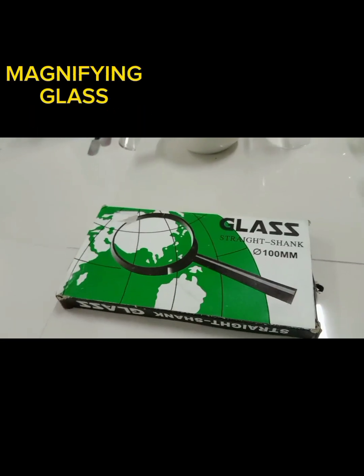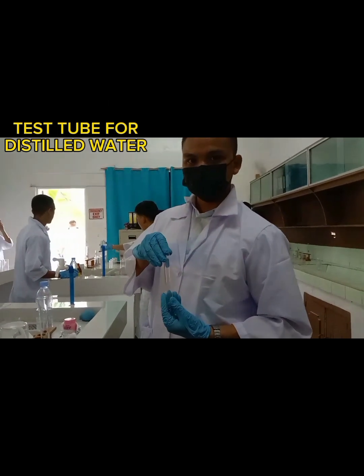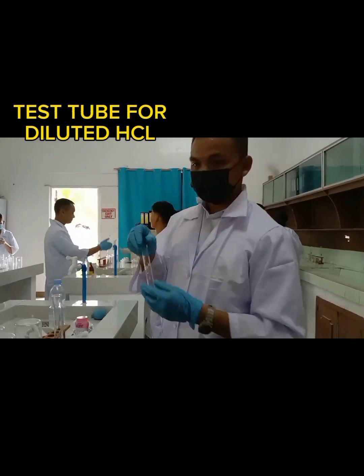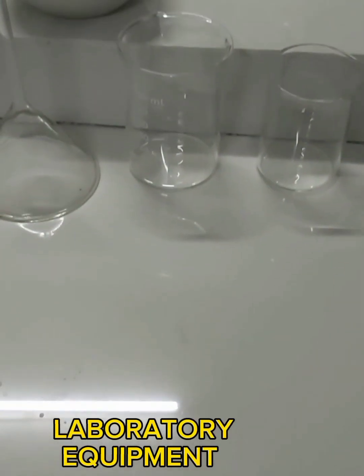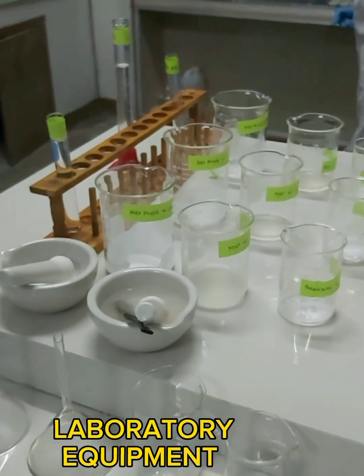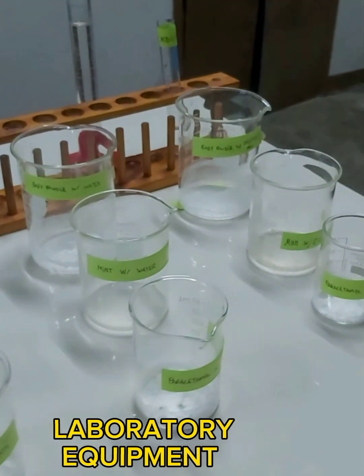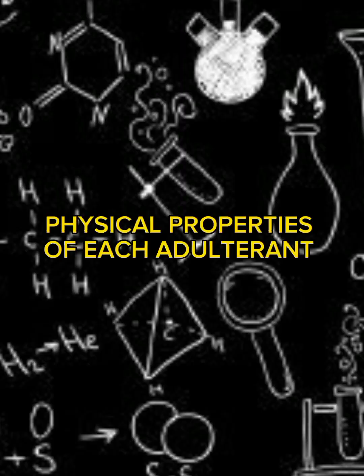mortar and pestle, a magnifying glass, a test tube for distilled water, a test tube for diluted HCl. These are the laboratory equipments. Physical properties of the adulterants.